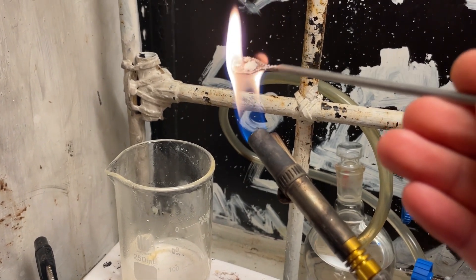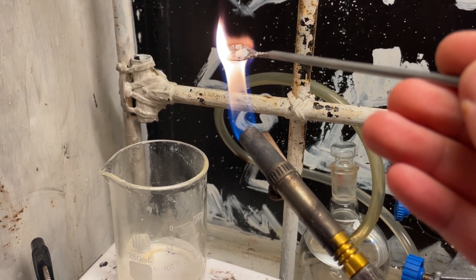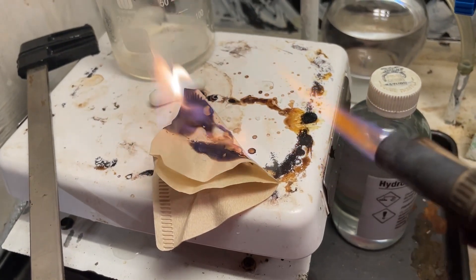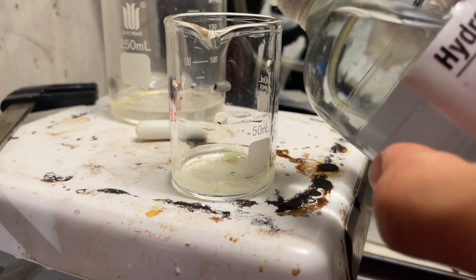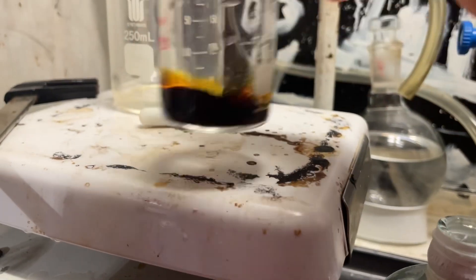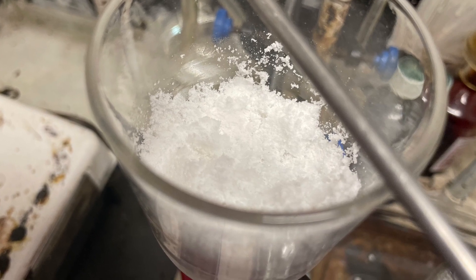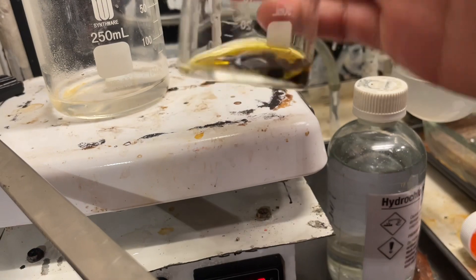I was expecting to do something a bit more energetic, such as evolving oxygen and making the luminous flame into a nice blue flame, but it didn't. I tried to use the wet product as an oxidant on some filter paper, but it didn't really do much because it was wet. To show that this is oxidizing, I mixed it with some potassium iodide and added hydrochloric acid — you can see it oxidizes it to iodine. Here's our product after drying it more on the pump; nice fluffy powder. The iodine eventually coagulates.